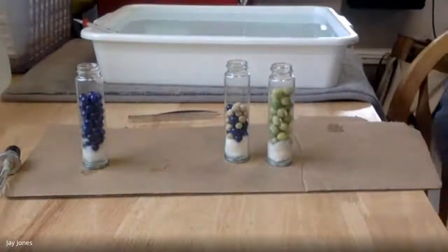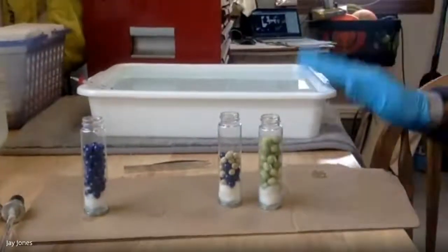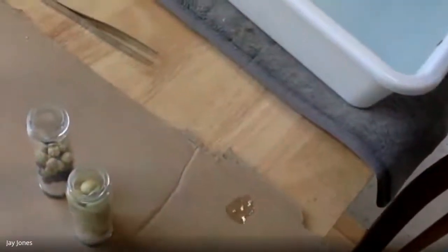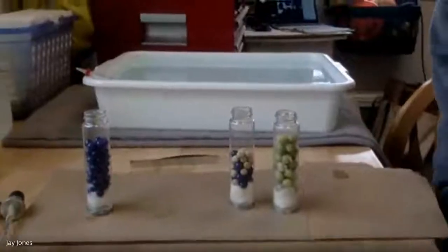All right, let's begin the lab. I have a bath of water here, and I set it right before class started at 10 C. Period 1 did it at 25 centigrade. With you guys, I'm doing it at 10 centigrade. And we're going to just collaborate.